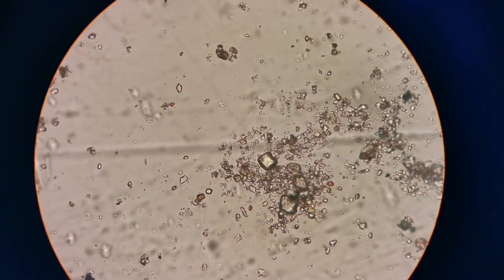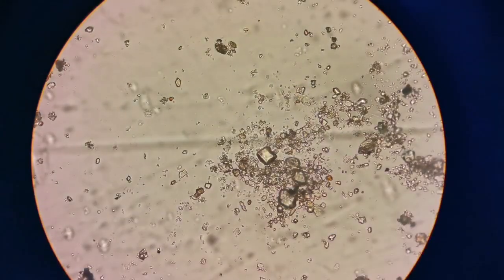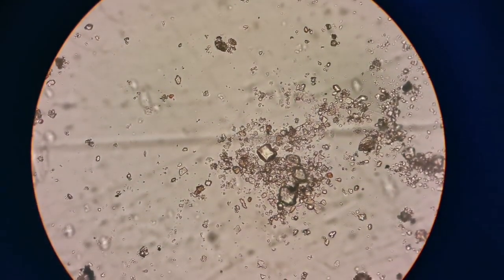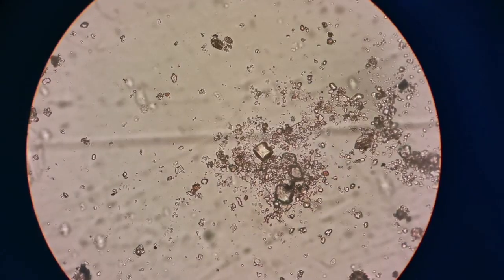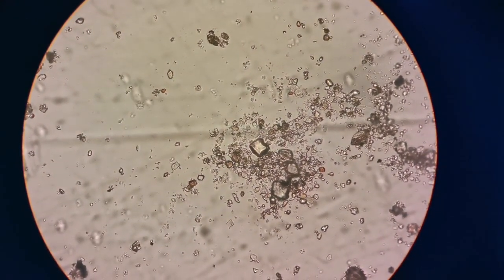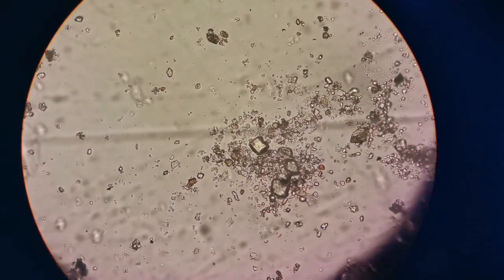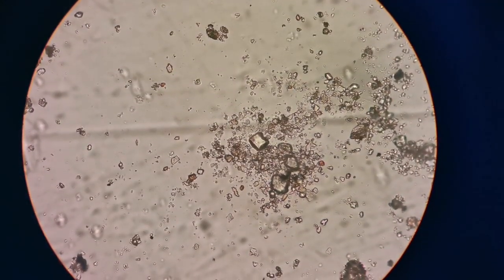Yeah, this is again magnified Sahara dust, that is from the car. It is definitely not uniform in shape. You can see particles of different sizes. I've highly magnified this now. So if I was putting a pollen here, a pollen would have looked much bigger, almost taking one third of the view.